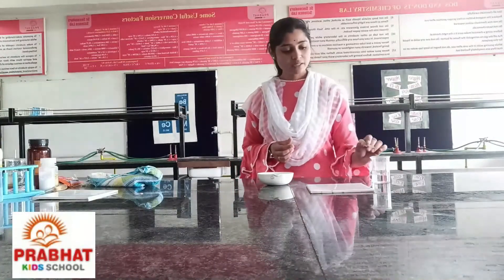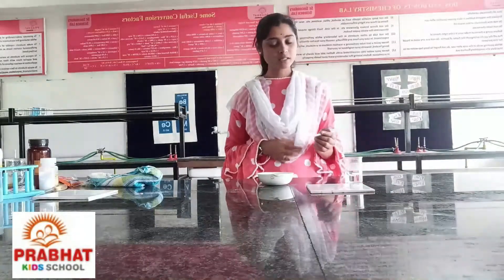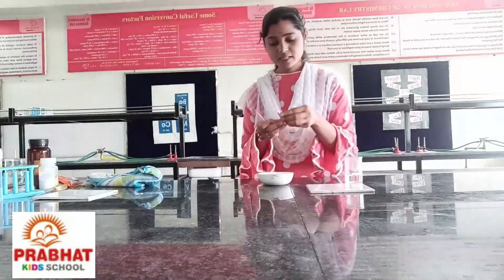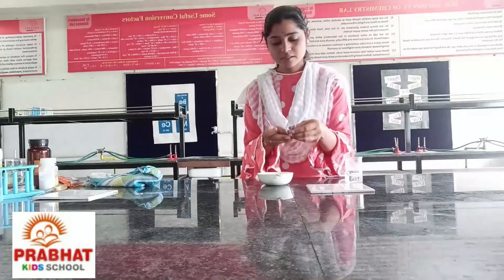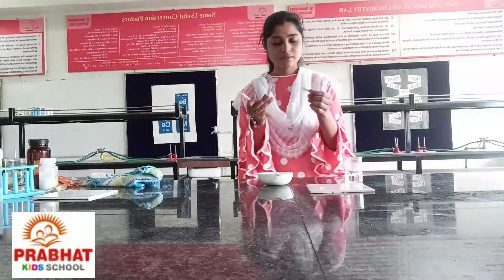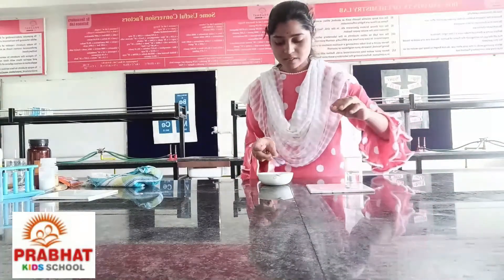Now, we have to check this given sample to determine whether it is an acid or a base. Take the red litmus paper and put it on the tile. Then, take the blue litmus paper and also put it on the tile.